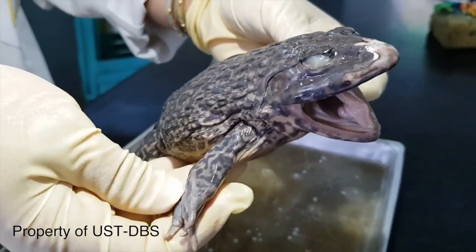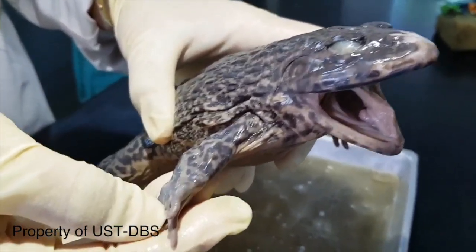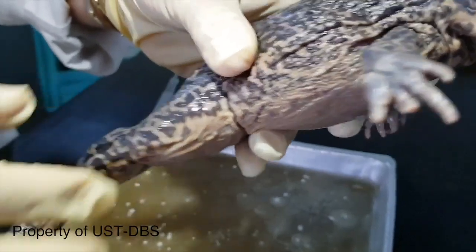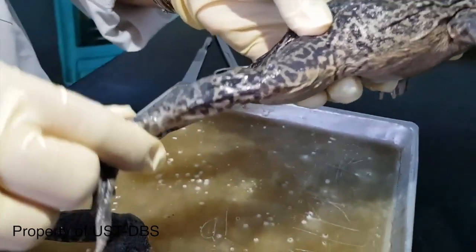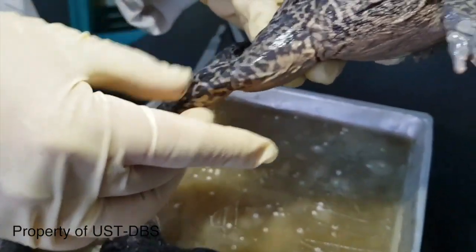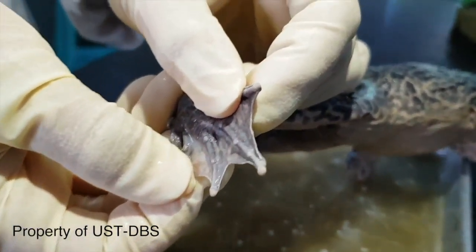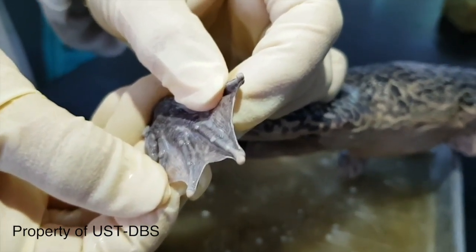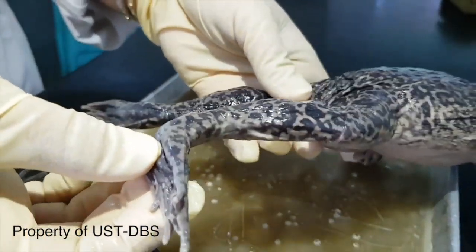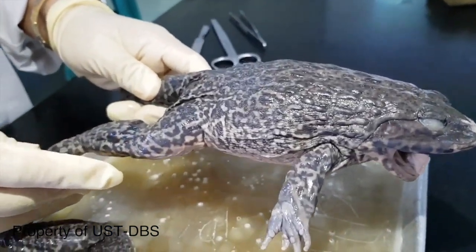On the upper limb, there's the upper arm and the forearm, somewhat shorter, with phalanges or digits at the end. The lower limbs are much longer, adapted for hopping for frogs. So the thigh, the shank, and the phalanges, which end in webs. The web is used by frogs for swimming if they are underwater. Then all of this, of course, is supported by the skeleton, by bone structure.